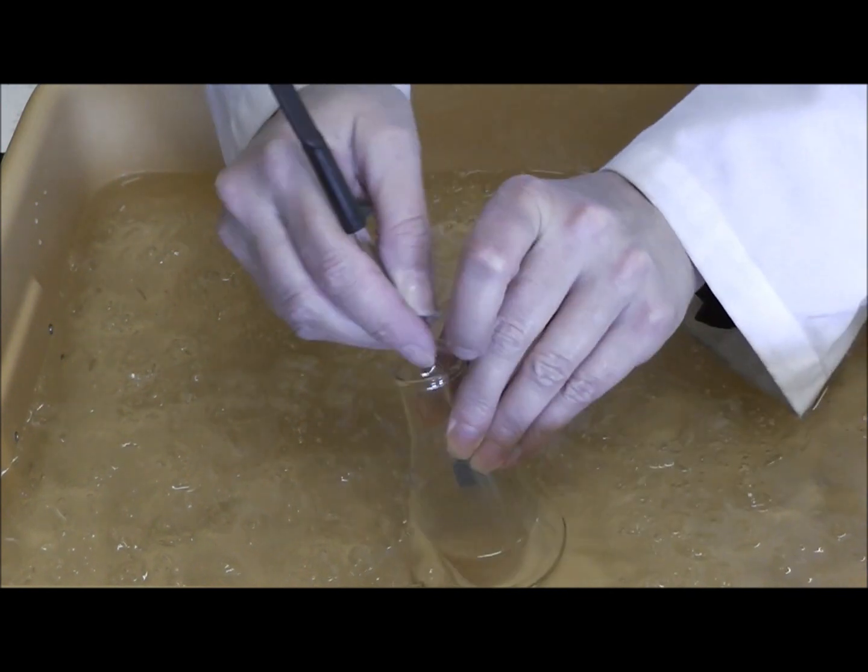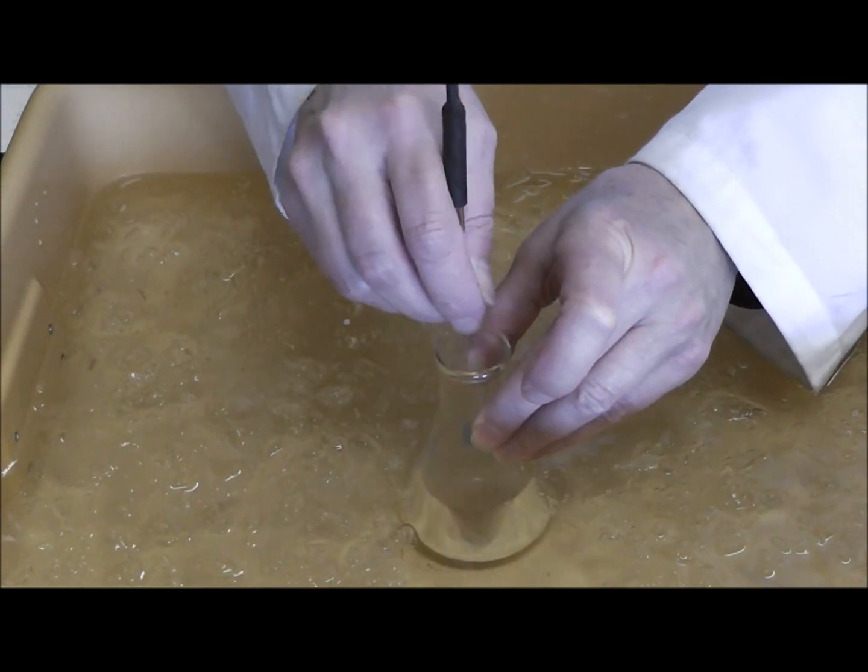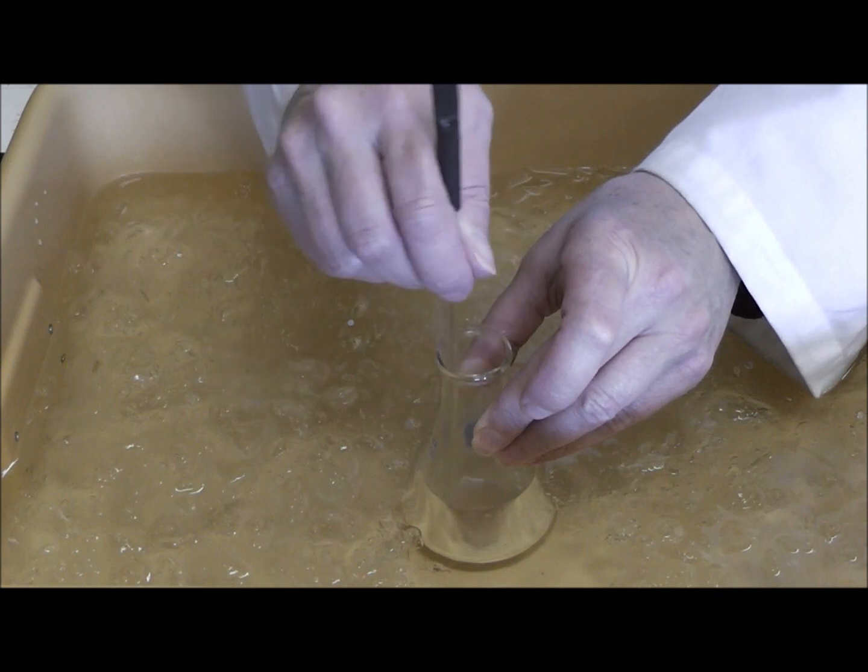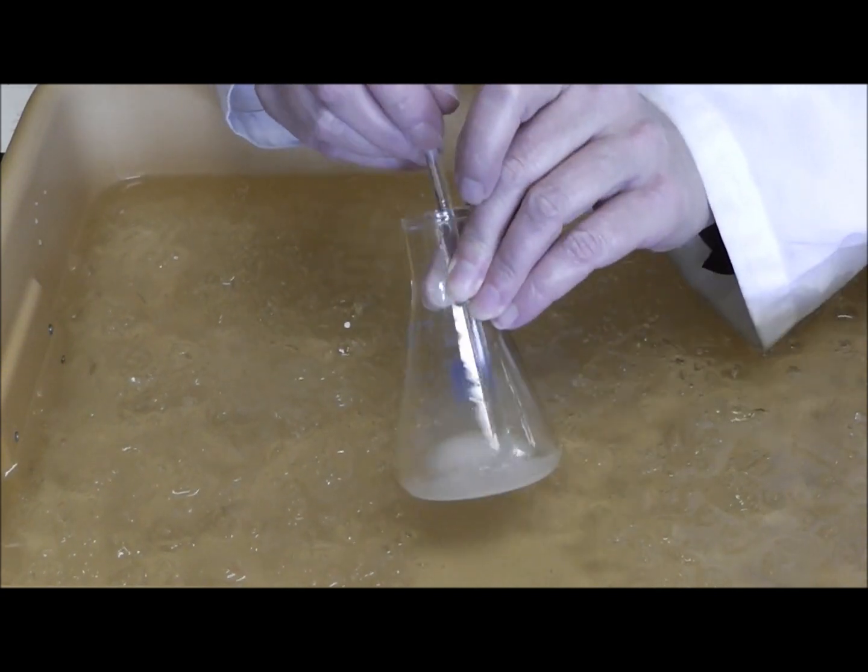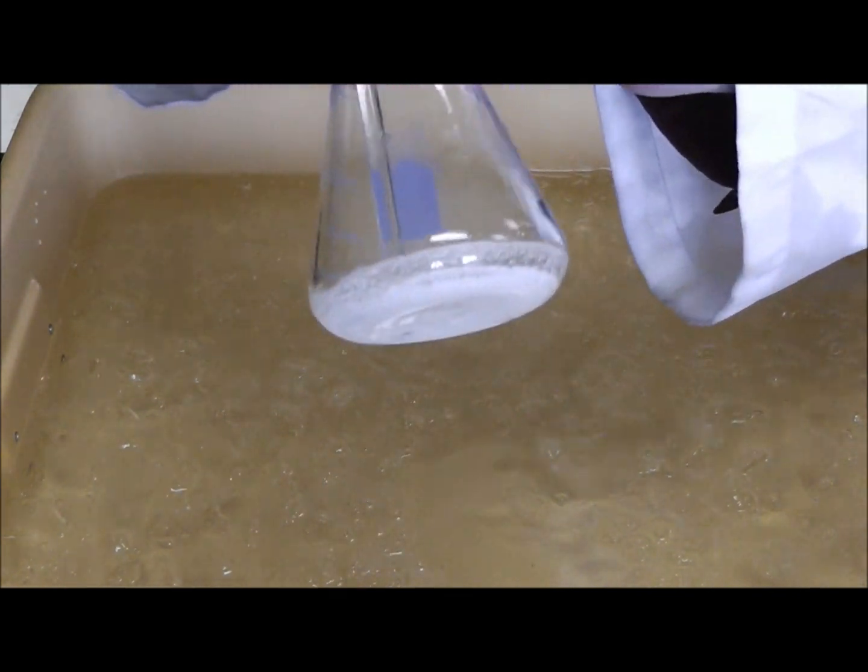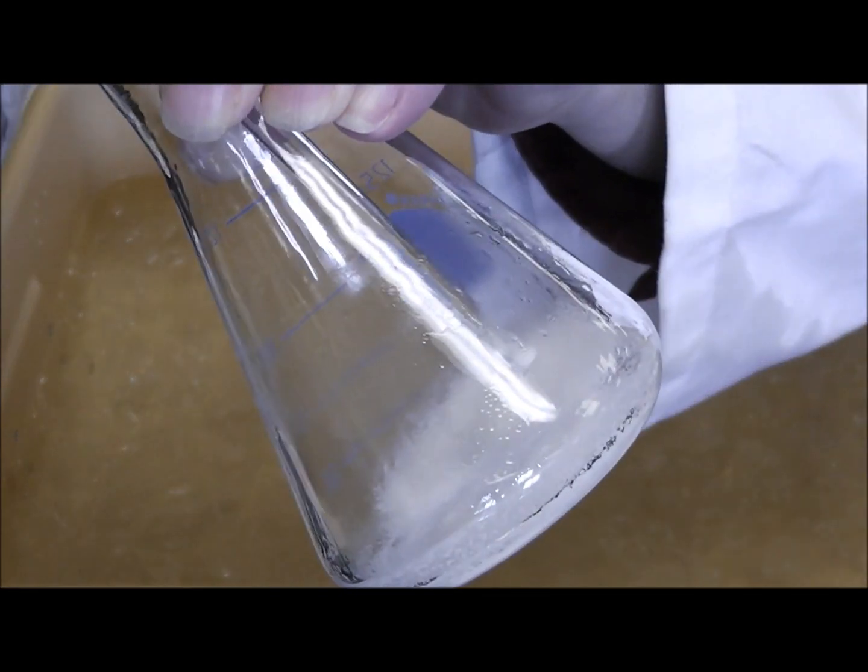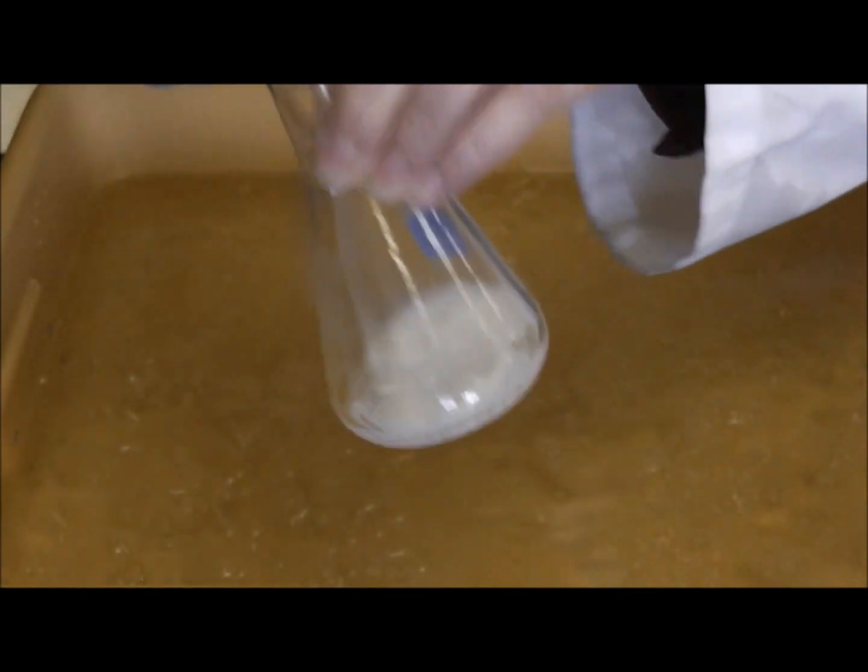I am going to stir, and I am going to watch for aspirin, crude aspirin to form in my Erlenmeyer, and if you notice, almost immediately. Take a look at that. See? That is crude aspirin forming almost immediately.